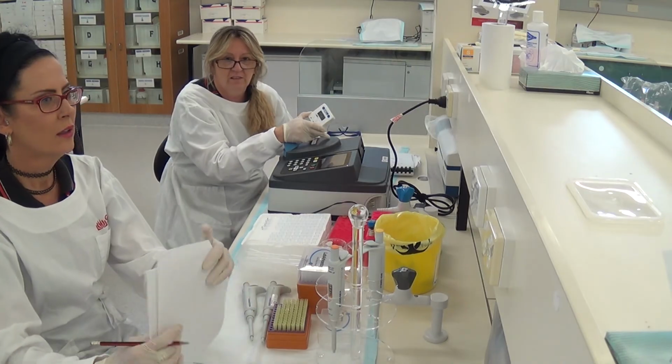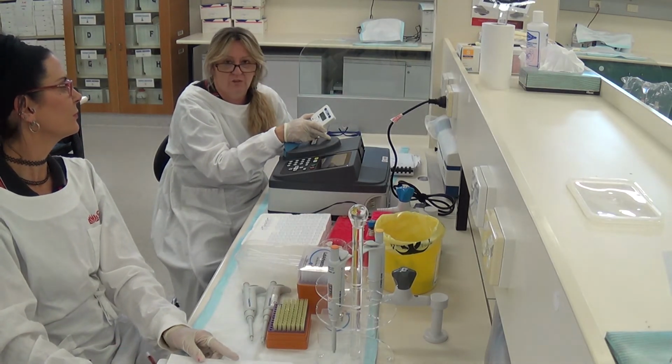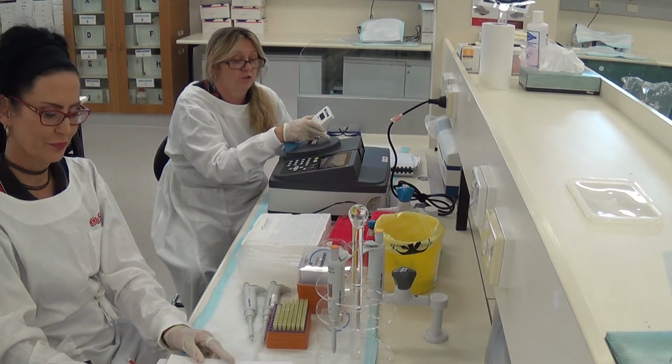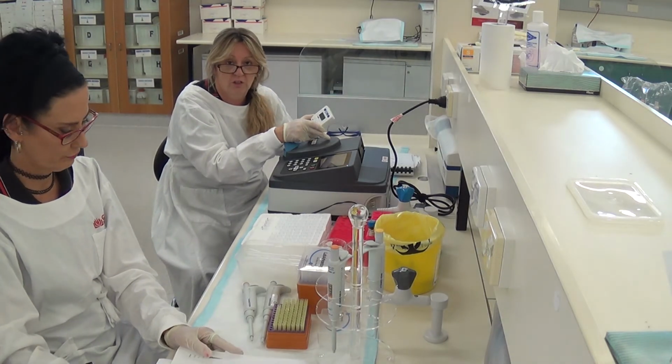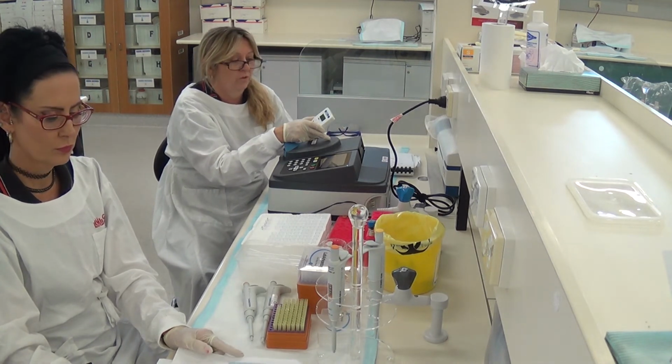So it's pretty obvious that as the time increases, the absorbance is increasing, all right? And that's going to correspond to our chemical reaction that I described to you guys earlier on the whiteboard. So we've only got one more to do.